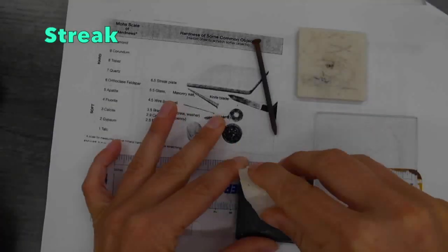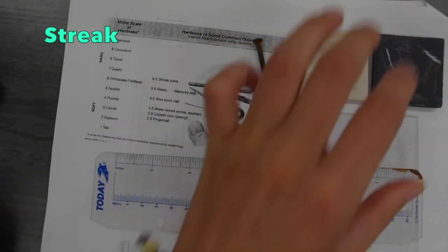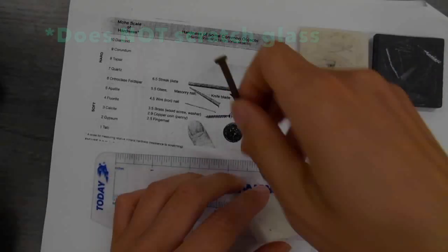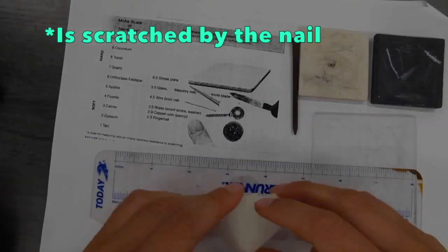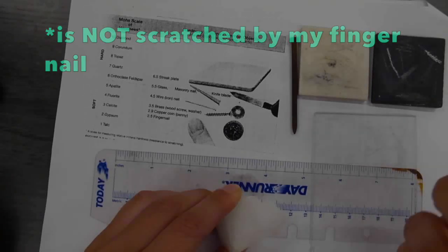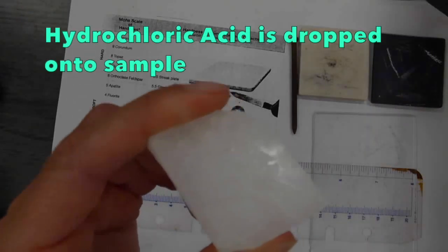First I'm going to do the streak test. A little streak, yep, there's the streak. Trying to scratch the glass. Kind of hard to see, but that does not scratch the glass. It is, however, scratched by the nail, but not by my fingernail. So you can use your little hardness scale to figure out what the hardness is based off that.